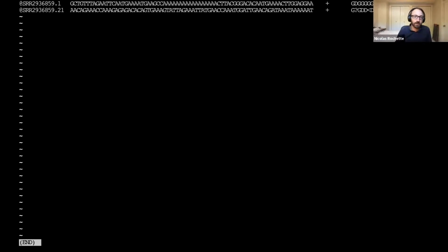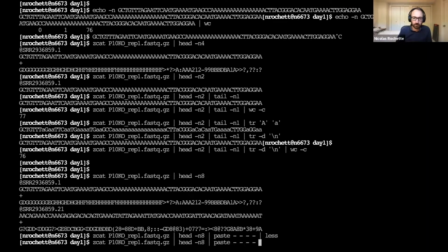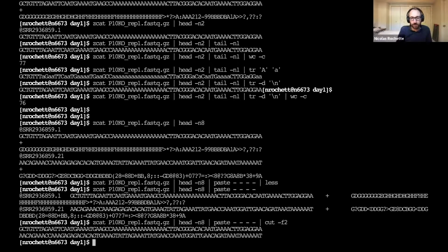It does like this. So this is opening in less the output. Oh, let's not use less. It just regroups lines by groups of 4. So it takes the first 4 lines, puts them on one line with tabs in the middle. This is the same thing for the second read. And so, for instance, I can then take the second column, and that's going to be just the sequences. Anyway, this is something that's useful for FASTQ files.